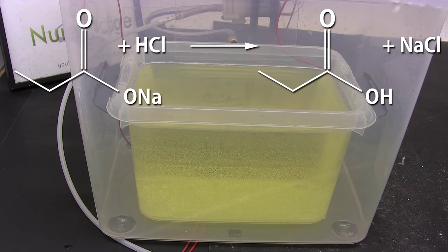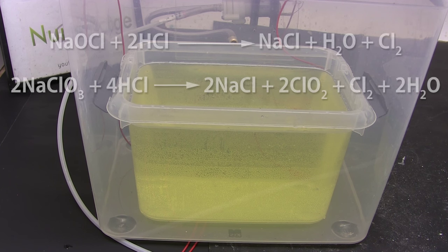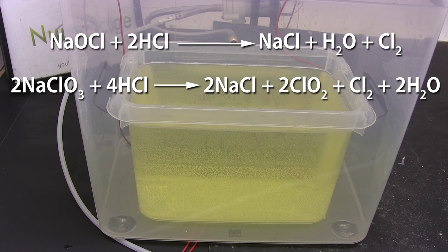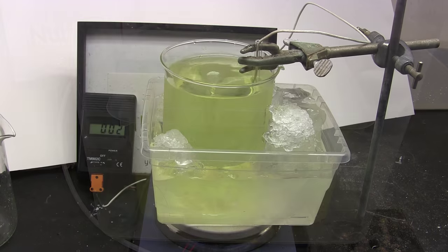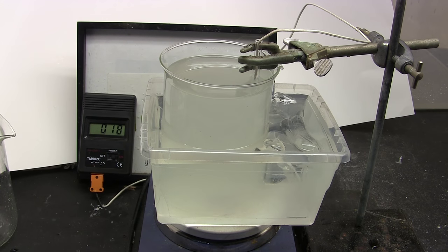Now I put the lid on the electrolysis box and sealed it, turning on the diaphragm pump to remove the gases. What the gases consist of is small amounts of toxic chlorine from unreacted bleach and chlorine dioxide. This comes from the reaction of sodium chlorate with hydrochloric acid. Now you're probably wondering where that sodium chlorate came from. Remember in my previous haloform video where I said my bleach was less concentrated than what the label said?